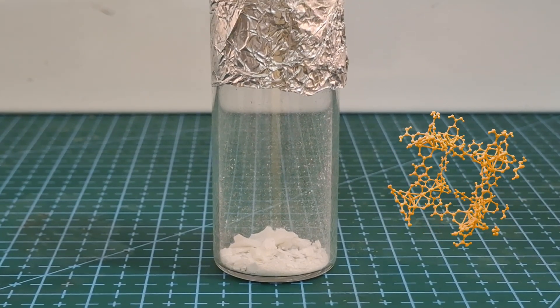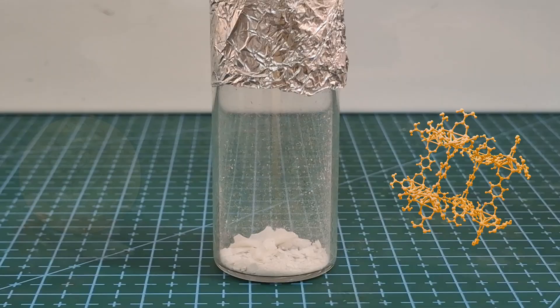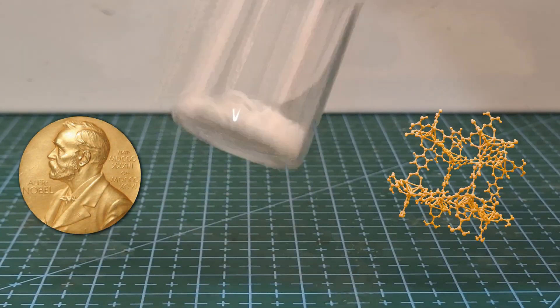This is a metal organic framework, specifically MOF-5. The field of MOFs have just won the Nobel Prize for Chemistry.